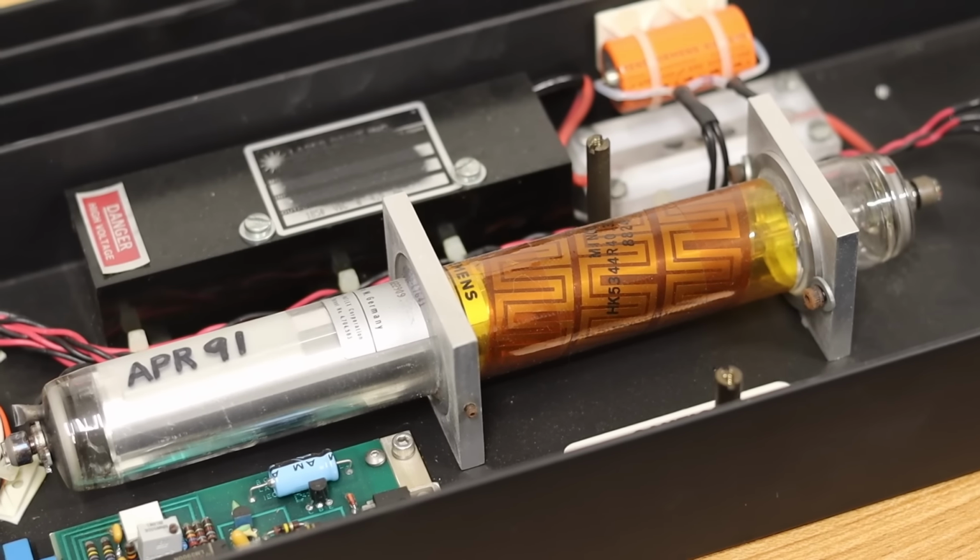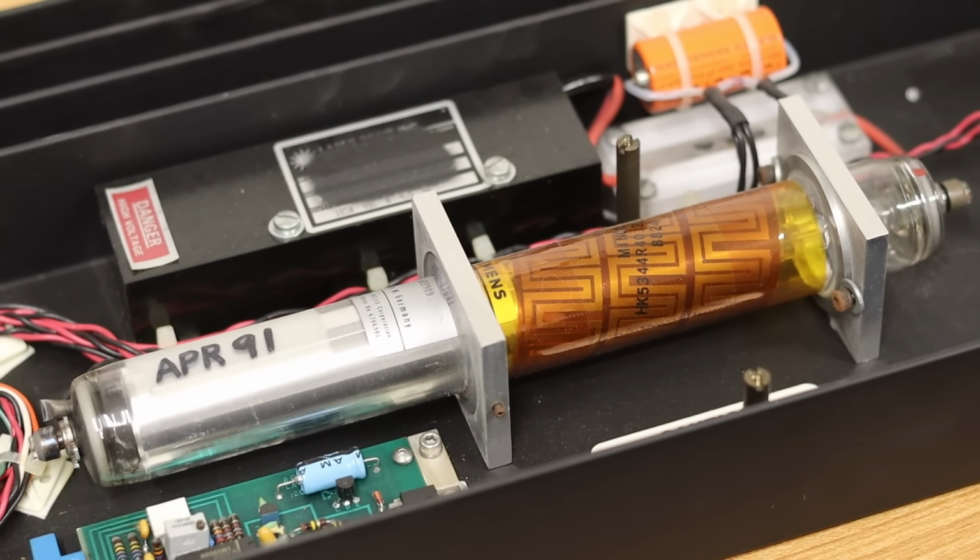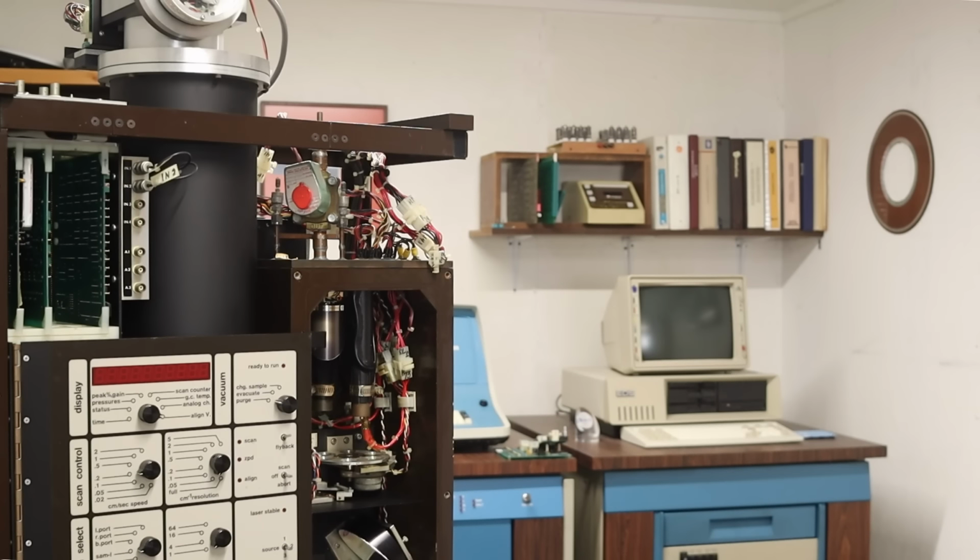Particularly our laser is a little ornery. It takes a couple of times for it to fire up, which tells us that it's getting a little gassy, and we're gonna have to replace that laser tube at some point in the future. But for today, let's just soldier on. So here we go, power coming up.